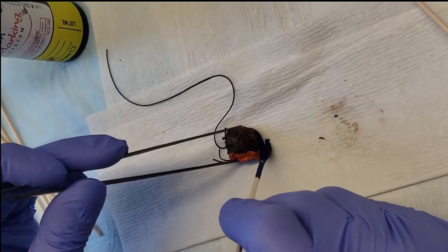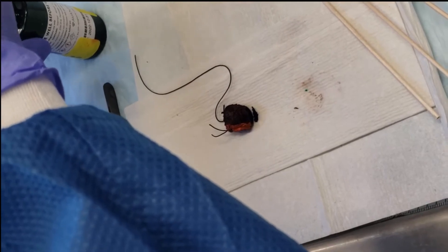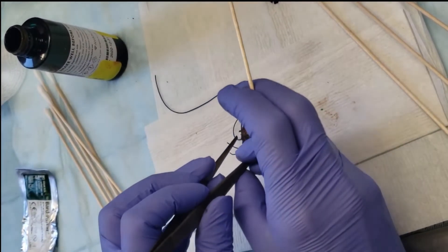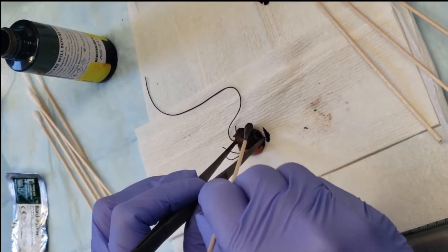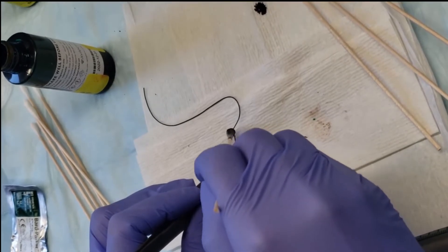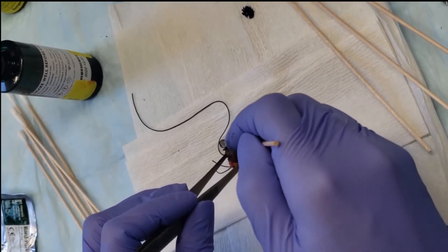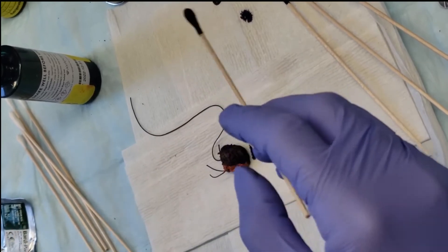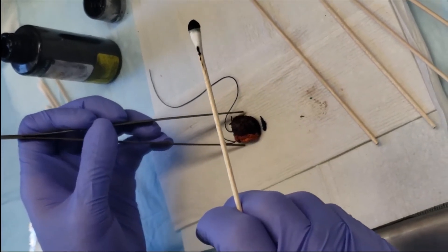The darker colors don't show up very well under this lighting, but in person we can definitely tell that there's a difference. This is violet going on and it's going to look very similar to blue under this light, but under the microscope we'll be able to tell a difference between blue, violet, and black. This is the last of our circumferential margins that we're labeling — opposite of the short suture, so this is the inferior. And the last margin that we mark is the deep margin, which is the margin at the bottom of the specimen.